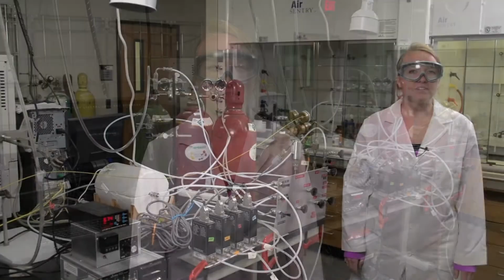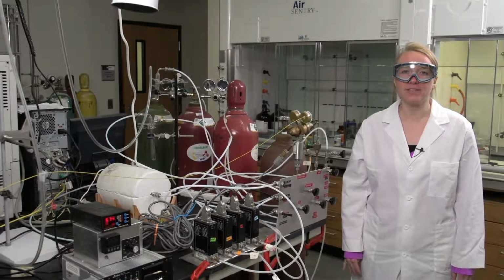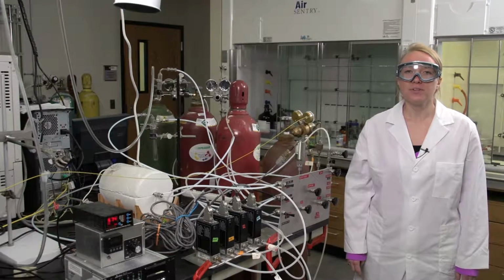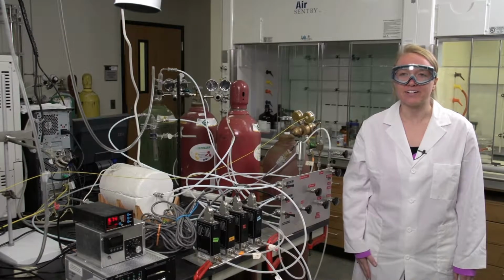In this experiment, you will be using mass spectrometry to study the efficacy of a catalytic converter. You will also be studying the temperature dependence of the reaction, and you will vary the pressures to determine the reaction mechanism. This is the portion of the lab that will be completed by the TAs if the time does not allow the students to do it. So this should probably occur 1 hour before the lab period starts.